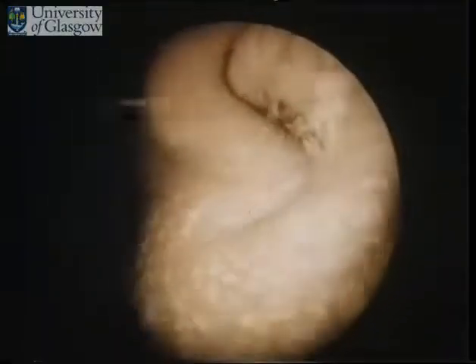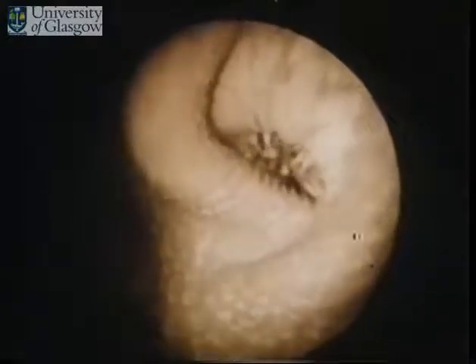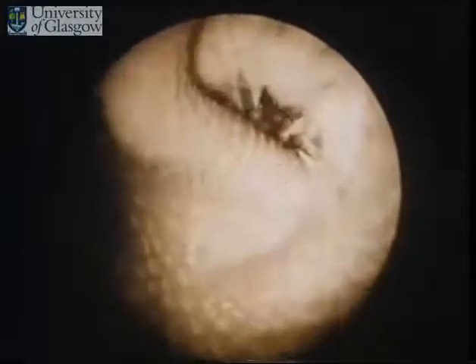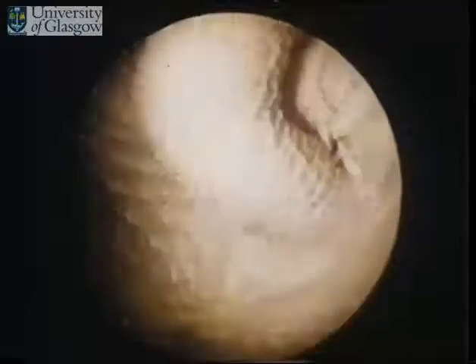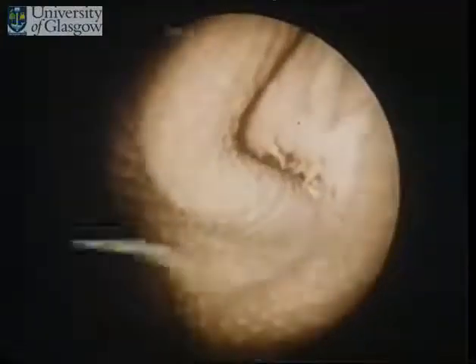We are now facing the reticulo-omasal orifice. The lips at the lower part of the reticular groove are slightly pulled apart in order to demonstrate the omasal opening. As one can see, the right lip of the reticular groove runs into the reticulum, whilst the left lip runs into the omasum.